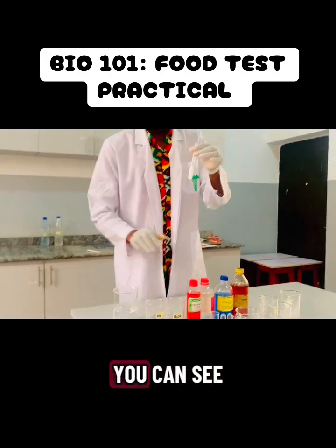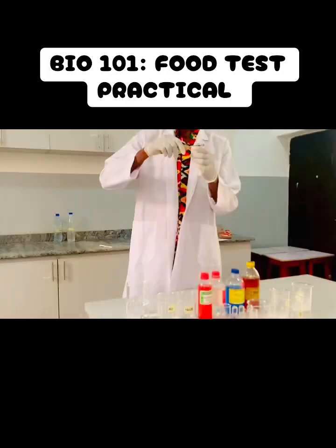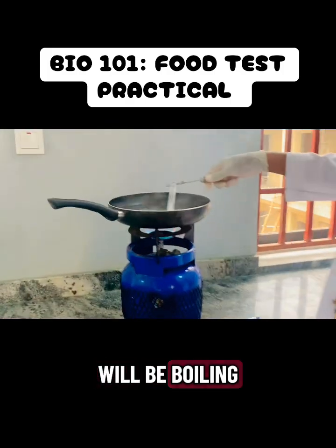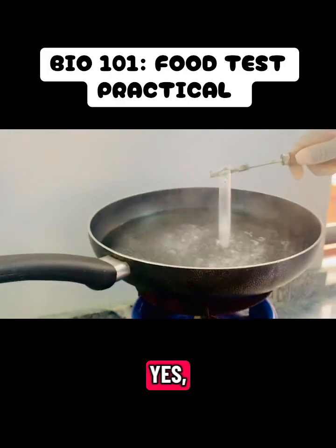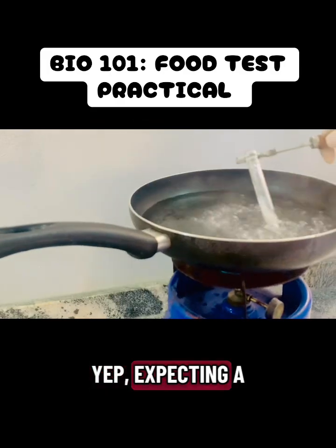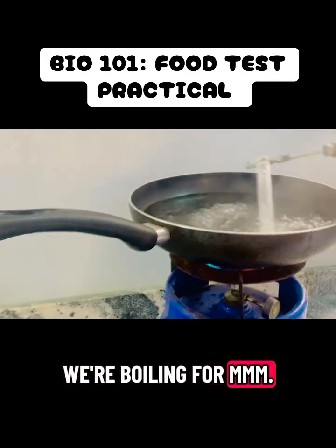Yep, so you can see that I'm shaking that thoroughly, and then I go with my test tube holder. And again, guys, I go ahead to boil gently. Yep. So I will be boiling this for a couple of minutes, yes, because we are expecting a color change. Yep, expecting a color change. That's it. So you can see we're boiling.